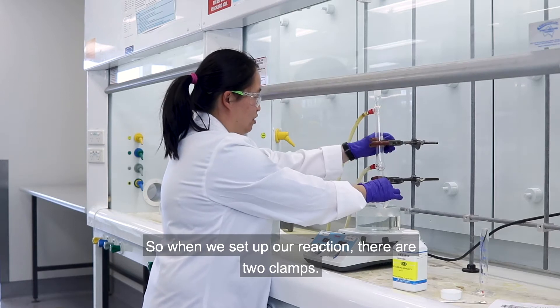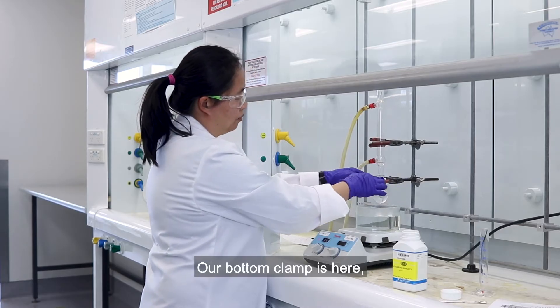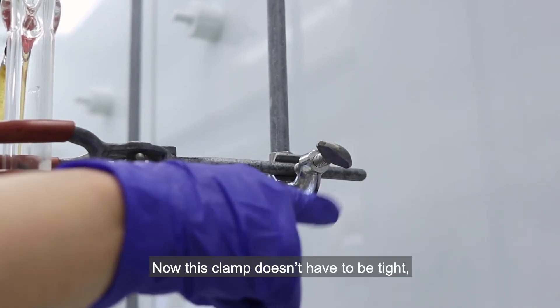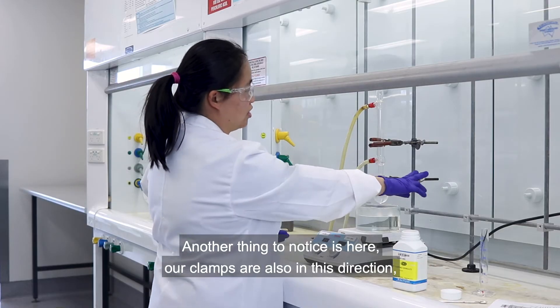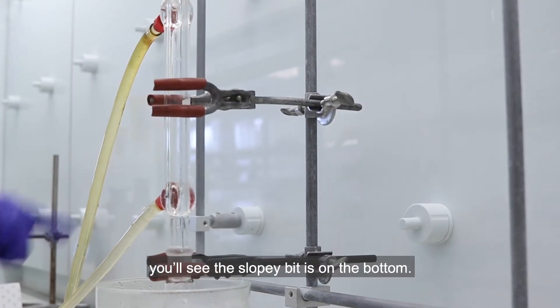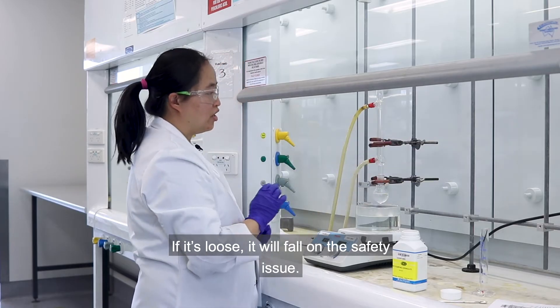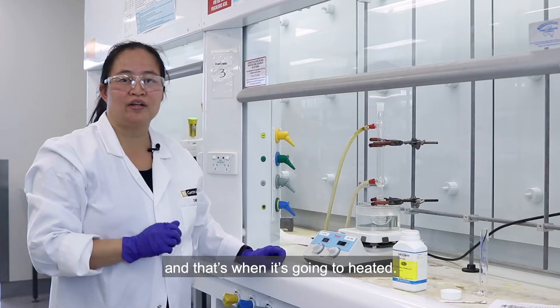When we set up our reaction there are two clamps. Our bottom clamp is where it has to be tight on our round bottom flask — that's what's holding it up. You also see a second clamp here; this clamp doesn't have to be tight, it's just there as a backup in case it falls over. Another thing to notice is our clamps are oriented so the sloped side is on the bottom — that's also a safety consideration in case they are loose.